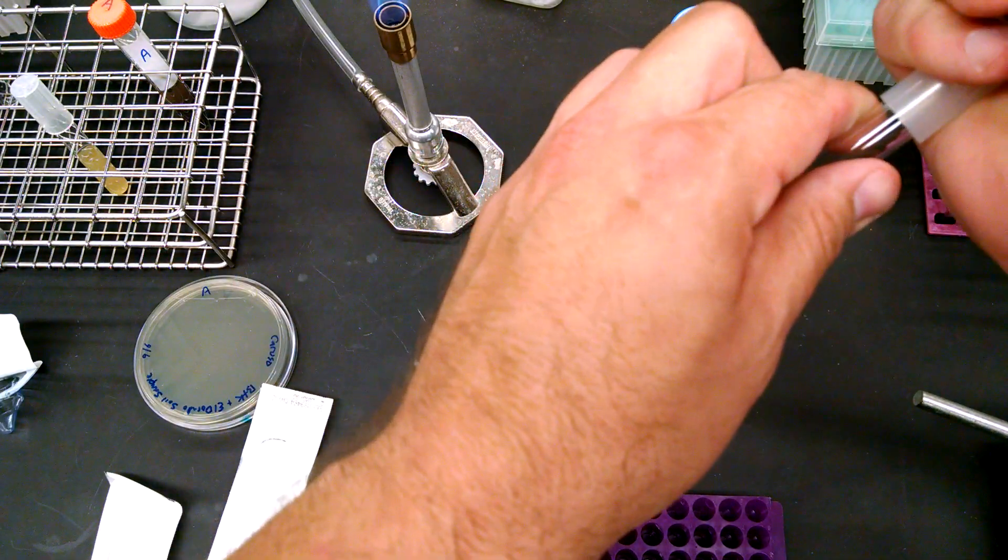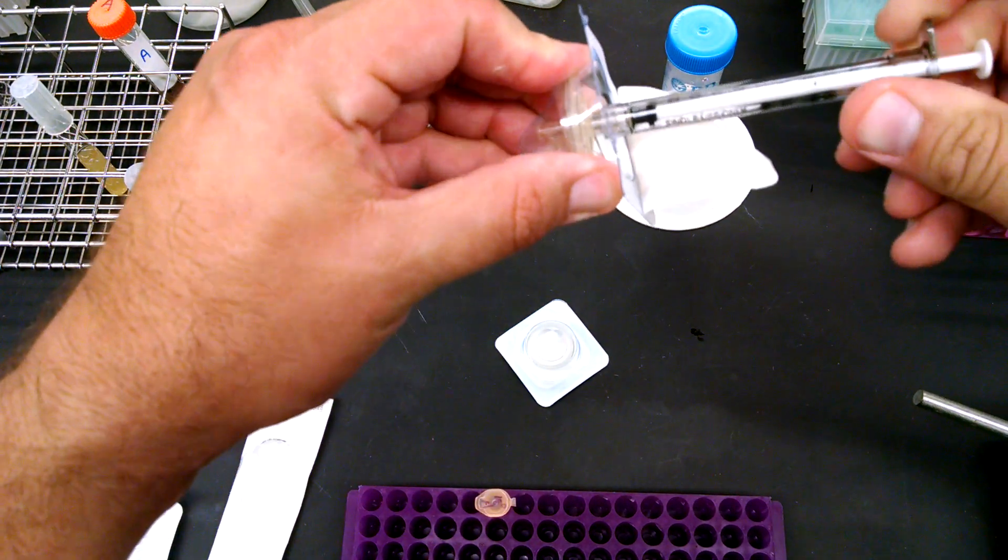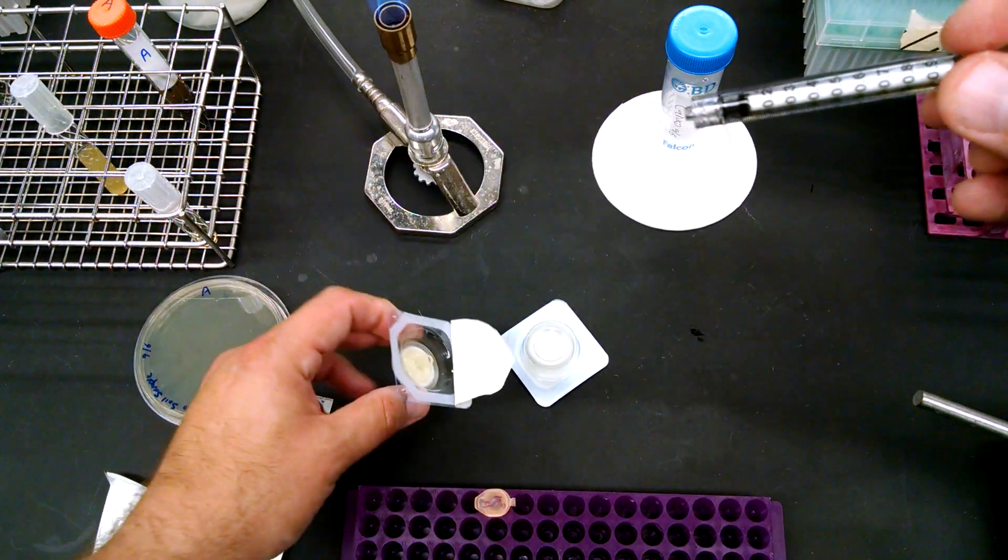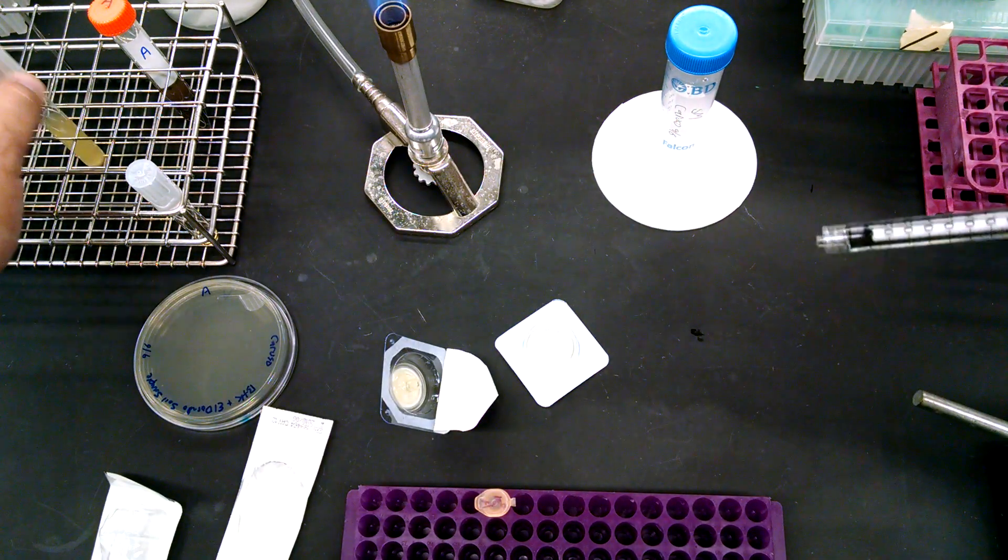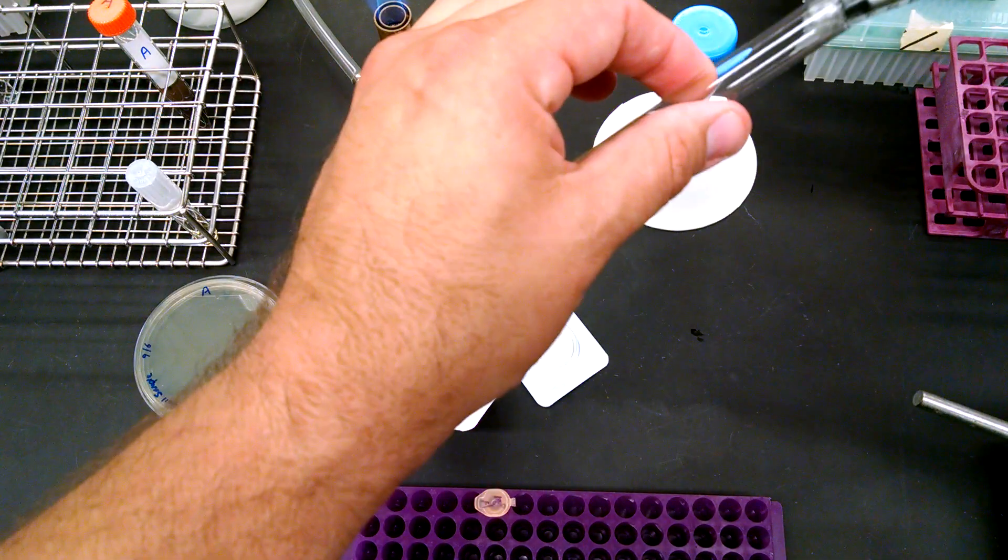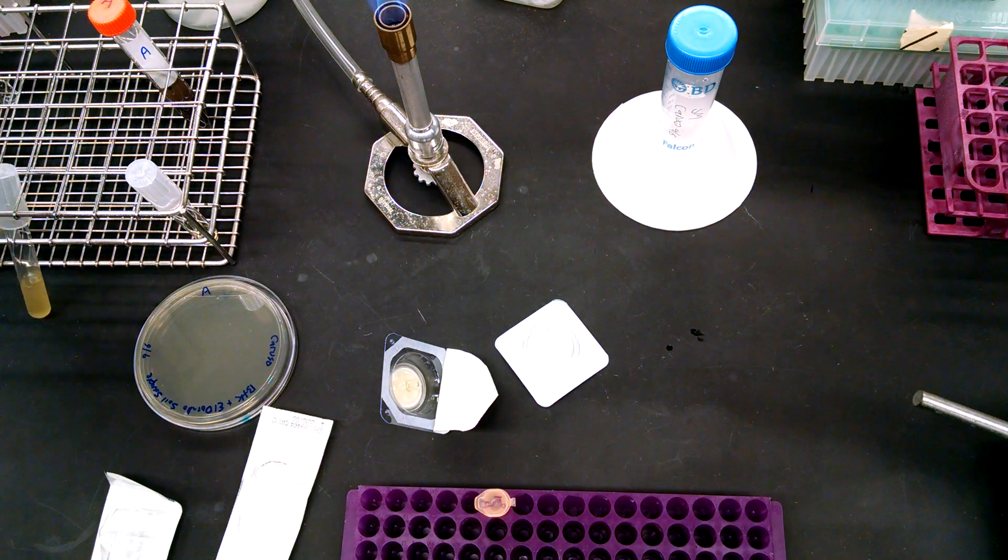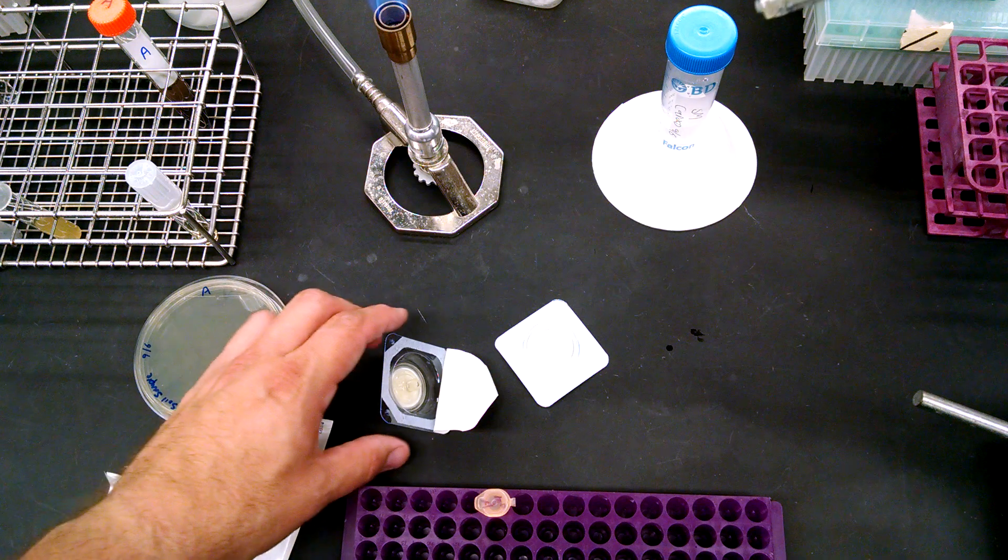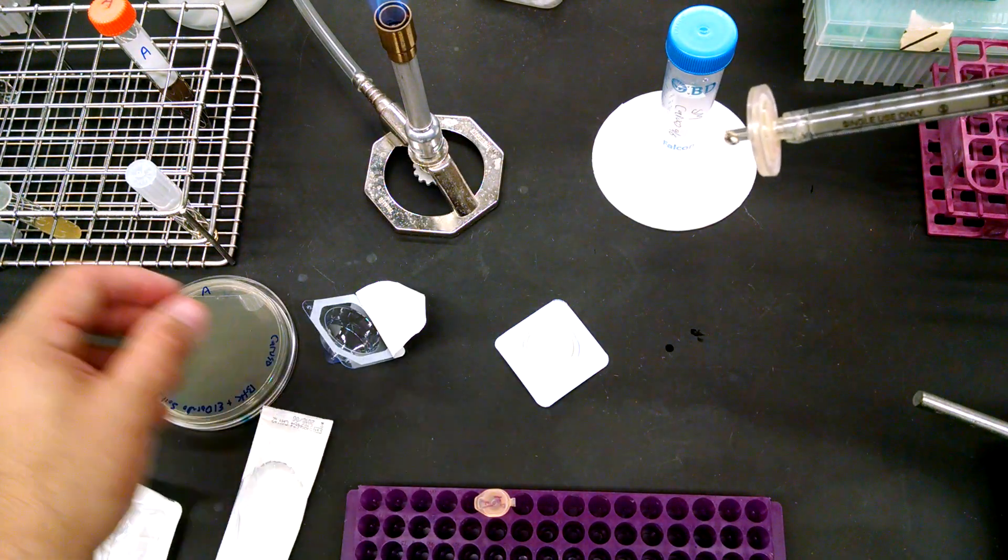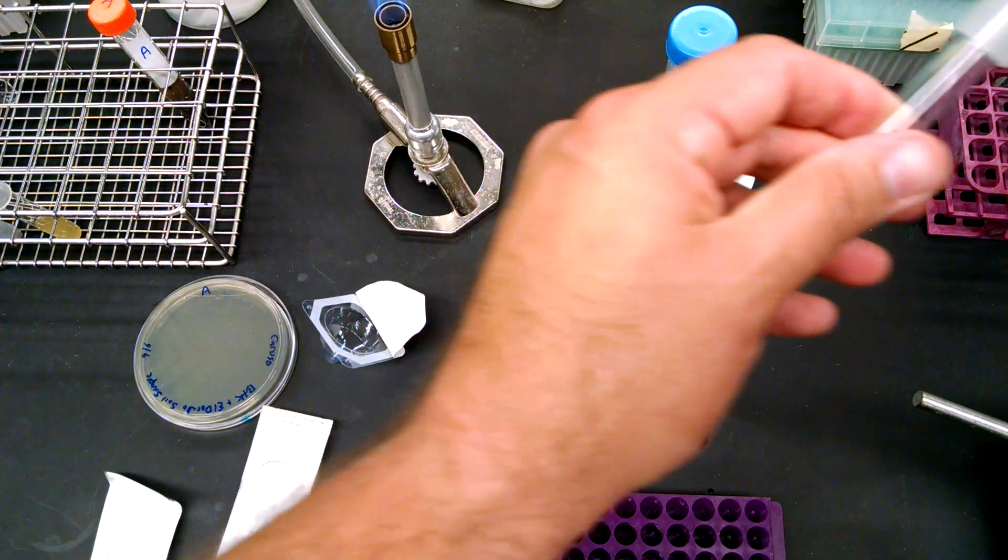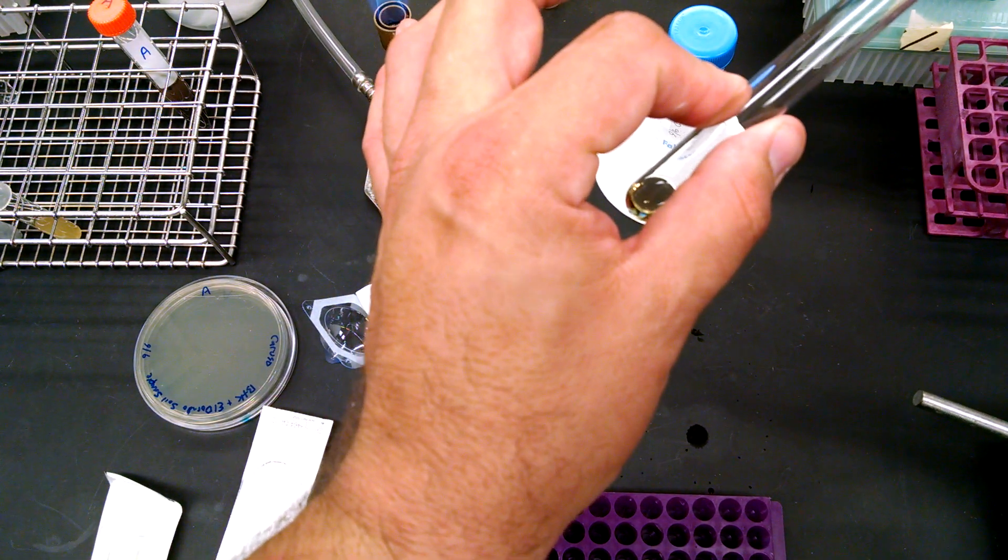Why don't I do another mil real quick? If you ever need to do this more than once, you can always take the filter off. Remember, always take the filter off before you pull out any plungers, right? Why don't I take another mil? There we go. You're never going to get the full volume back. You're always going to lose a little bit sticking to the filters. Don't be surprised. All right. Push that through.